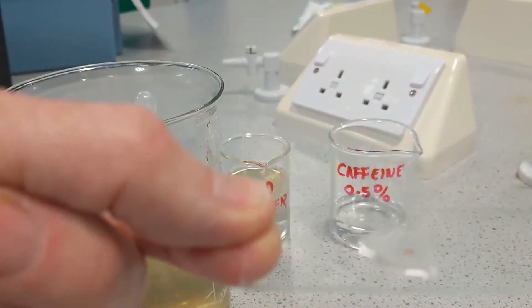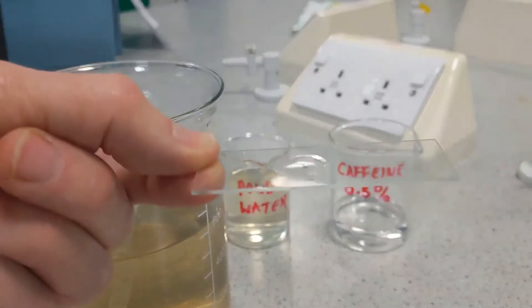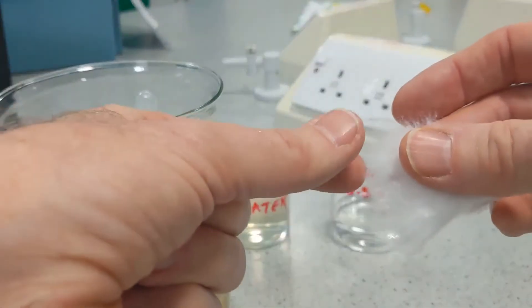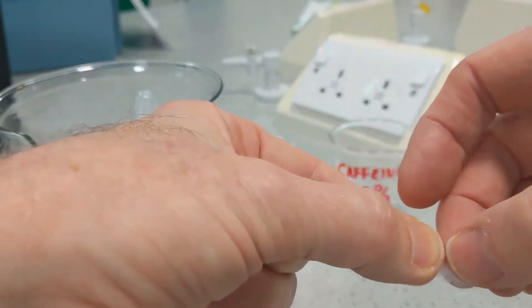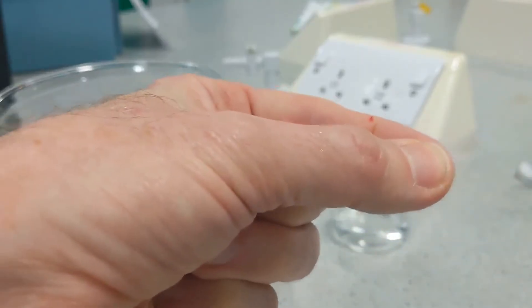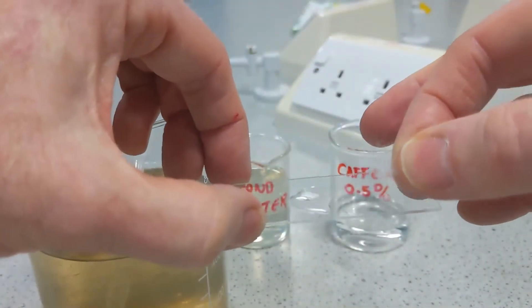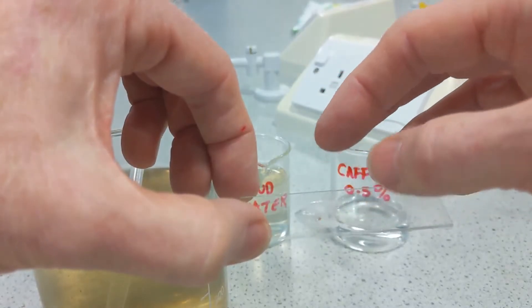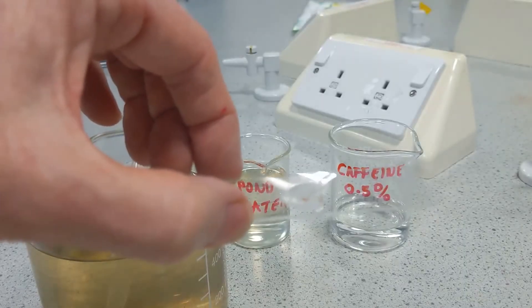Your Daphnia will be running around on the surface of your slide — it will be hard to keep control of. So the best thing to do is to make your Daphnia happy. To do that, give him a little bit of cotton wool to be able to grip onto. Just the tiniest wisp of cotton wool — a few strands. Place those just into the edge of the water droplet, not on top of him, just to the side. You'll find he will kind of stop moving and grip onto the cotton wool.